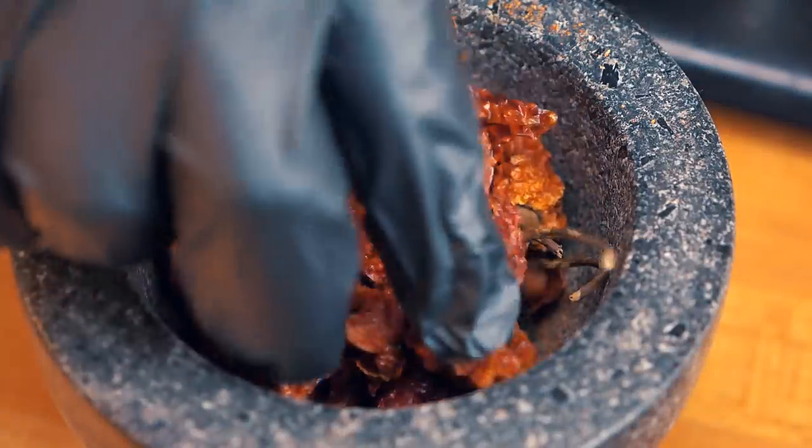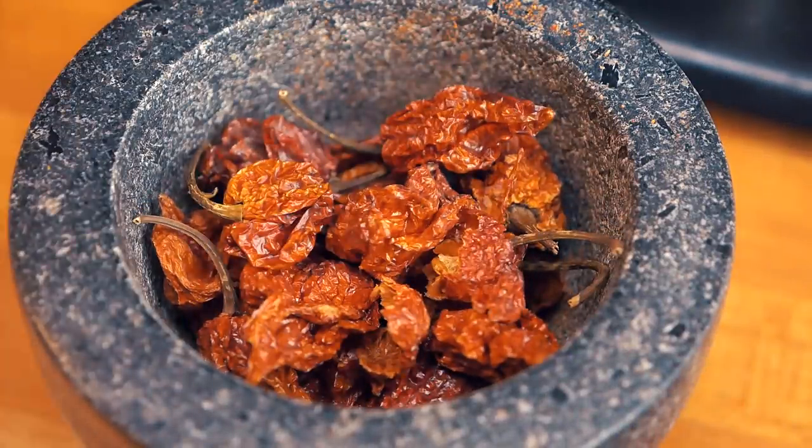Before we do anything further, we need to crush up these lovely peppers that we've dried, so let's get that done.